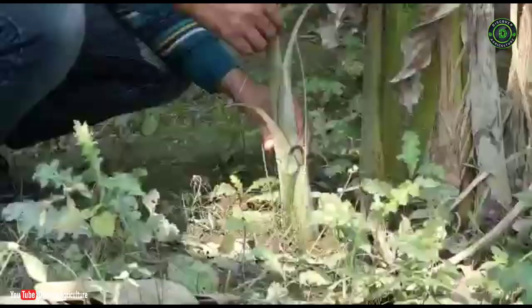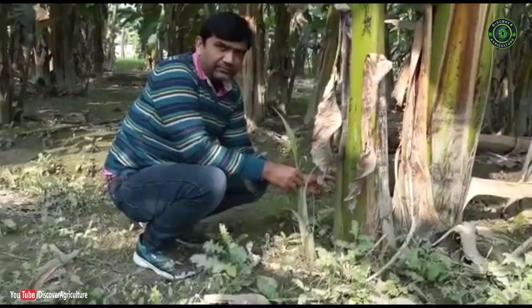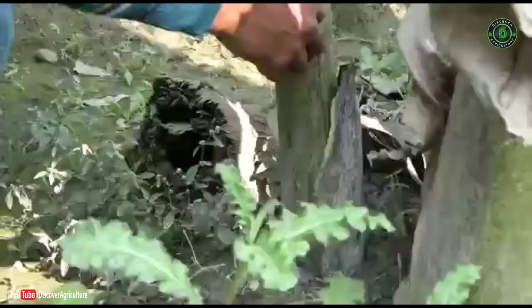What could be the explant for micropropagation? Shoot tips can be extracted from the pseudo-stem, suckers, peepers, lateral buds, or even small eyes which contain a shoot meristem.